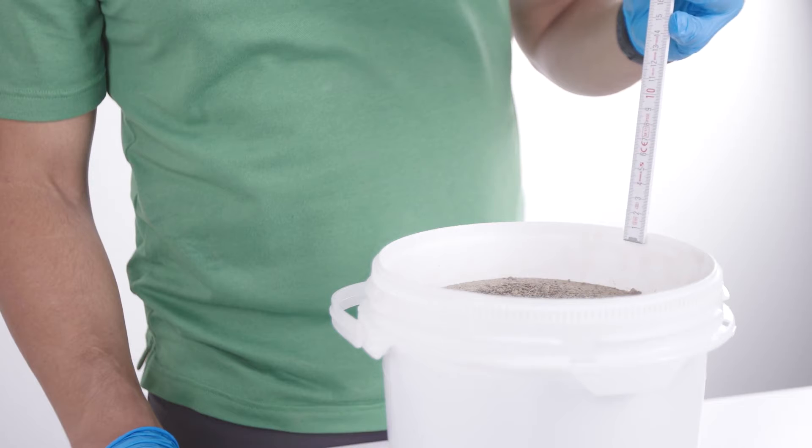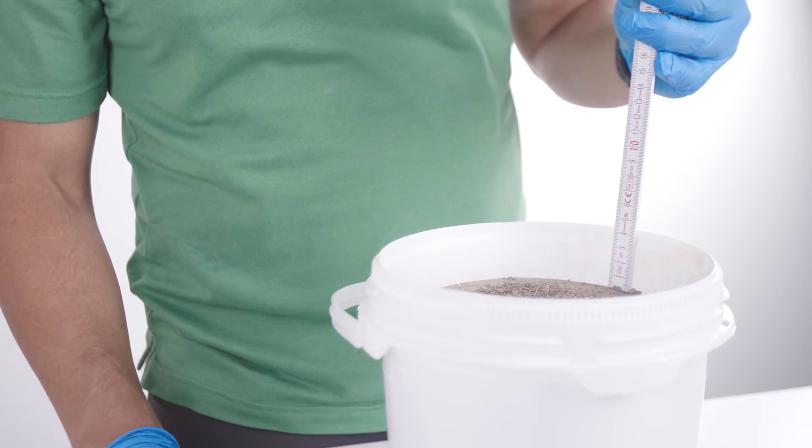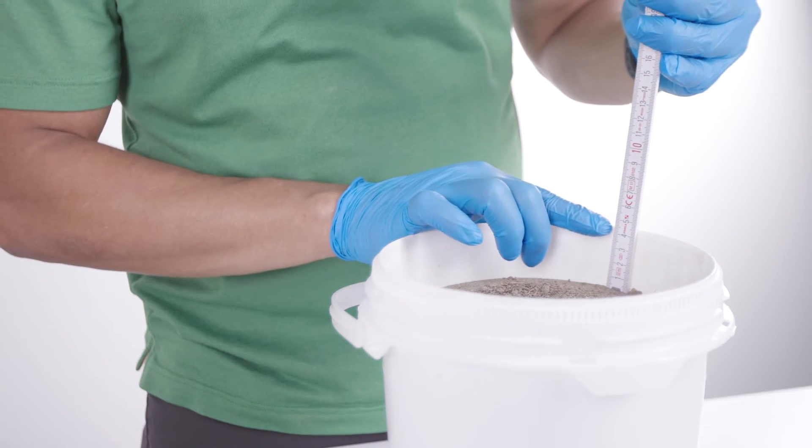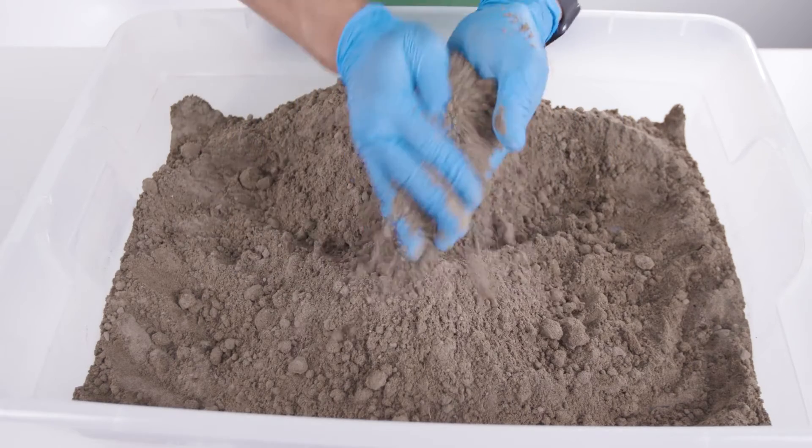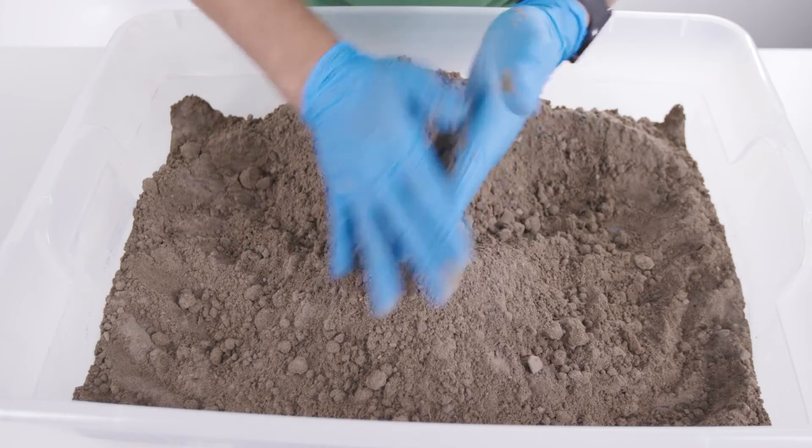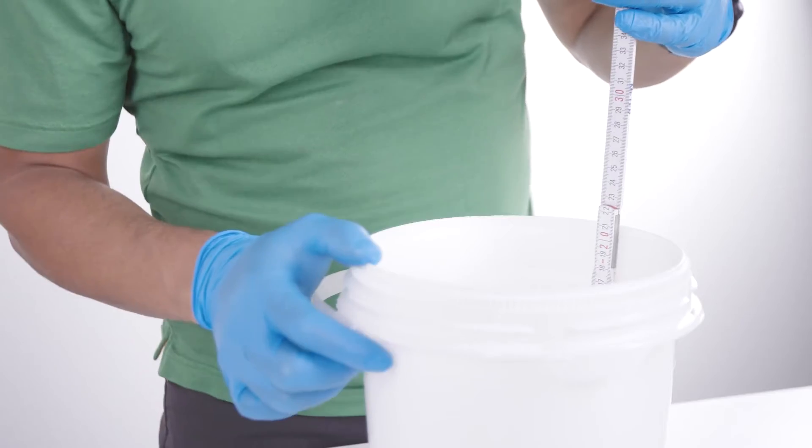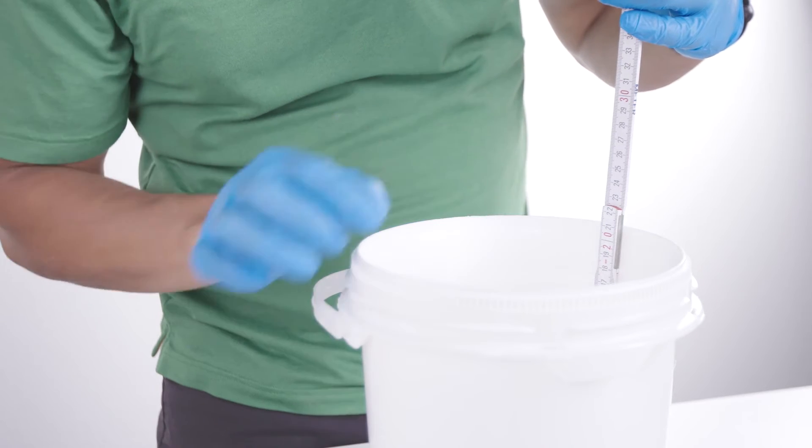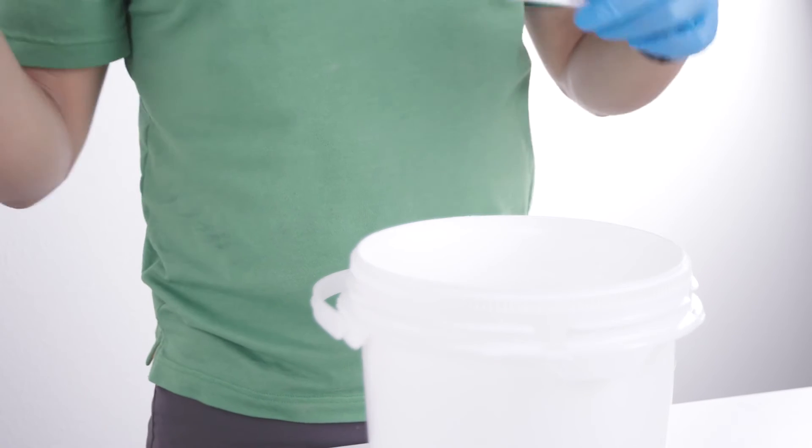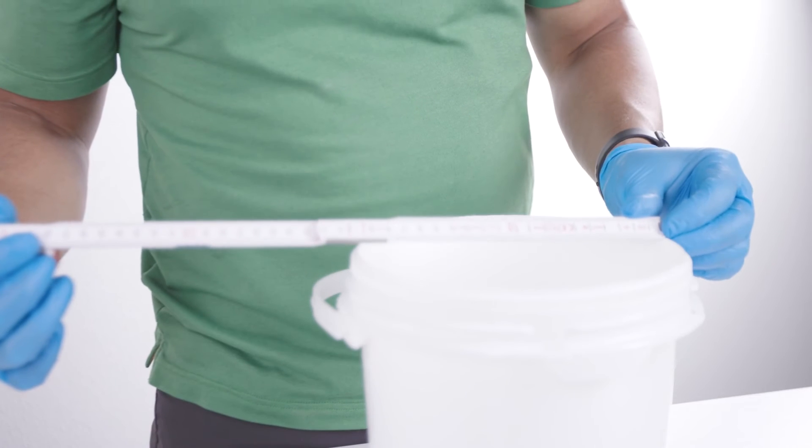For fine textured soils, like silt loam and clay soils, take a height measurement from the lid down to the base of the soil. Over time, the volume of finer textured soils will change with the addition of water. Sandy soils don't have this issue. If a height measurement is taken and the dimensions of the container are known, then it's possible to perform a volume change correction in the volumetric water content calculation. For instructions on performing a volume change correction, contact customer support.